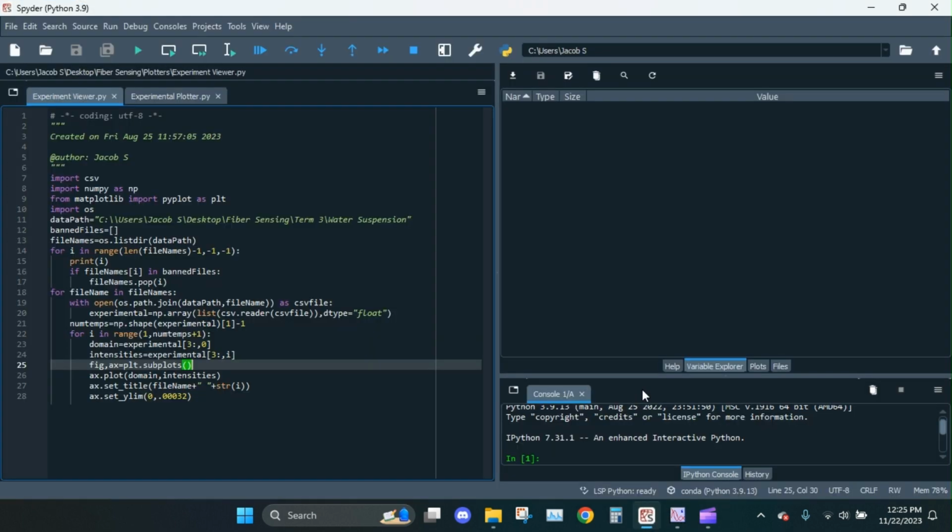First thing I'm going to do is go to my Python IDE. I have Spyder. You can use whatever you want. Then I have made two different programs. The first, I have Experiment Viewer. And all this is going to do is just show all of the spectra we record in quick succession, so we could basically watch a video of the entire experiment.